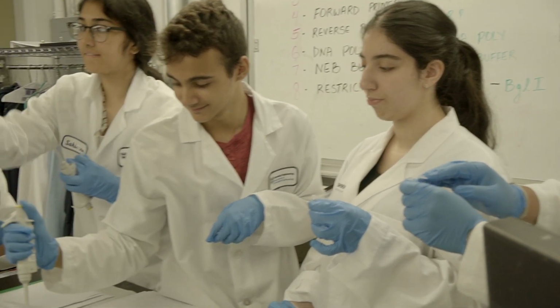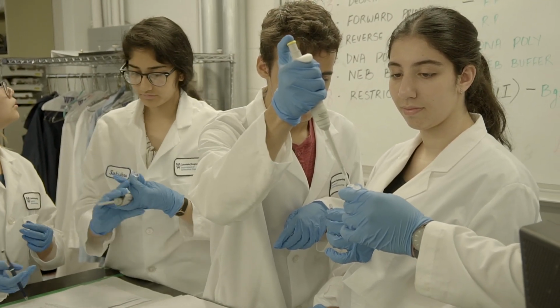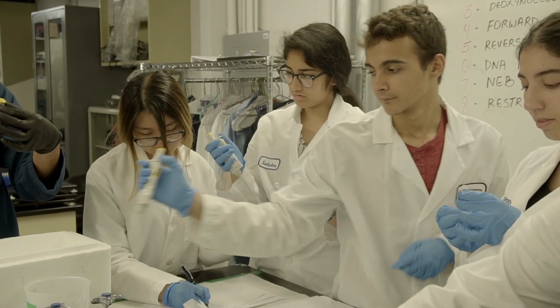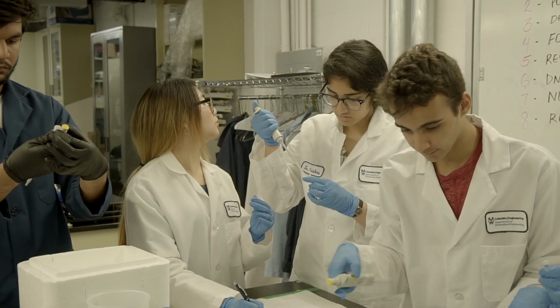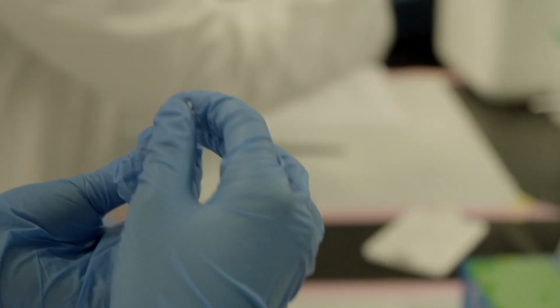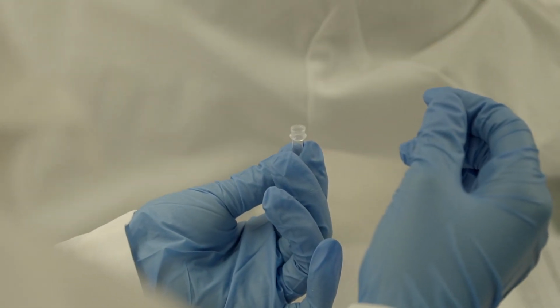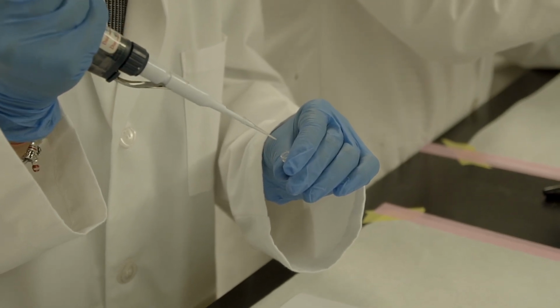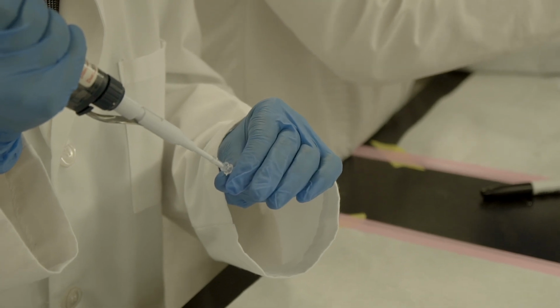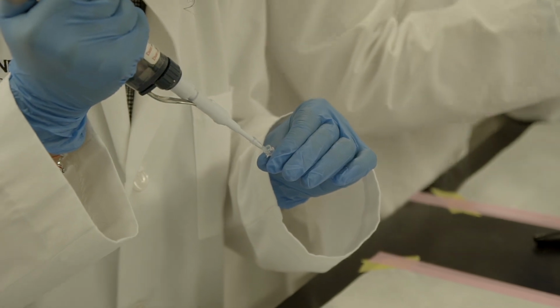Just cut out that small piece so that it'll come off and then you want to amplify. Also, for some reason, it says plasmid solution. That's the same thing as pUC19. I apologize for there being 5 different names throughout the protocol. You have a question? If you need more pUC19, I can get you more. There was supposed to be enough, but.